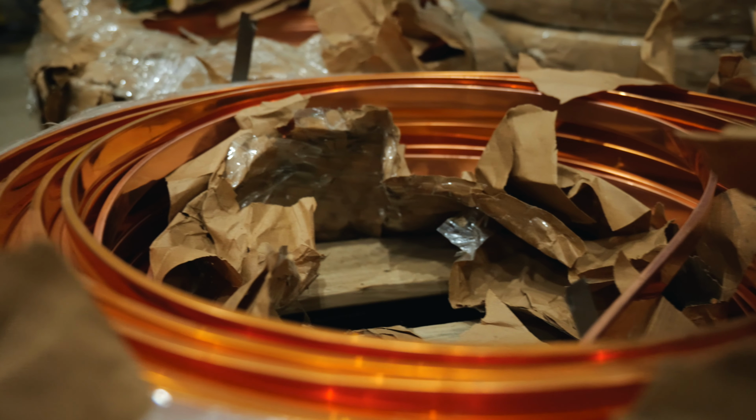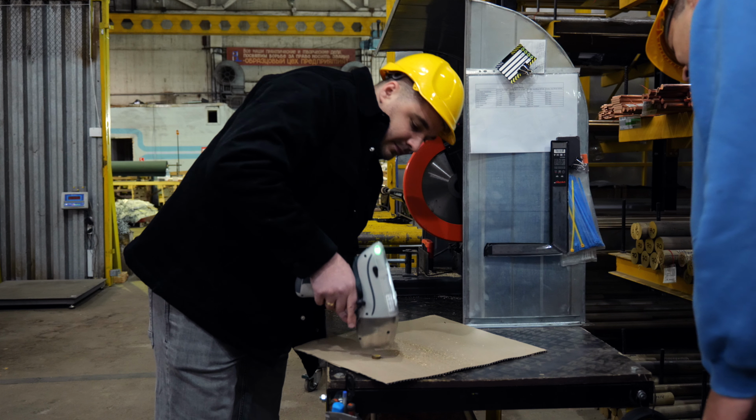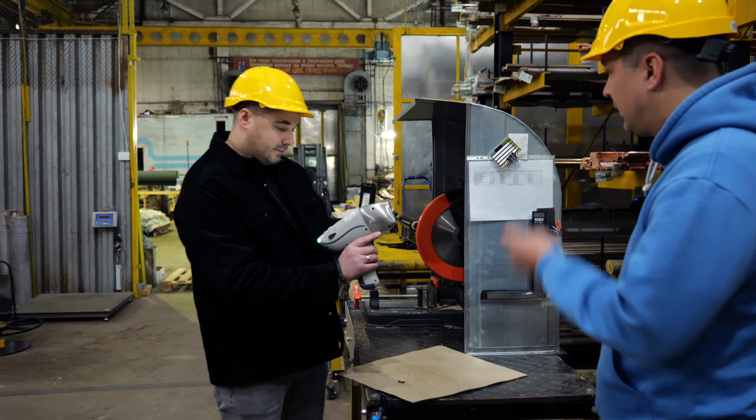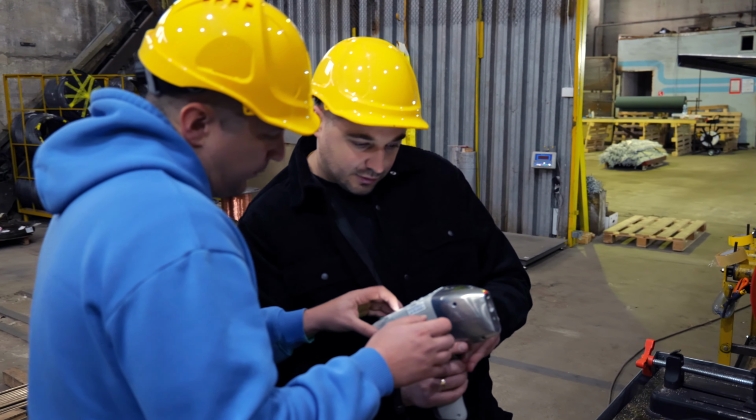So, if you work with metal every day, accepting scrap, sorting stock, checking product quality or doing incoming inspection, you constantly have to answer two questions. What alloy is this and does it actually meet the grade we need? These are exactly the questions that alloy grade and compare to alloy modes are designed to answer.